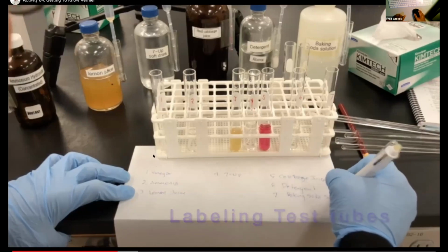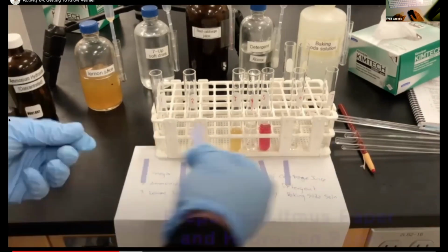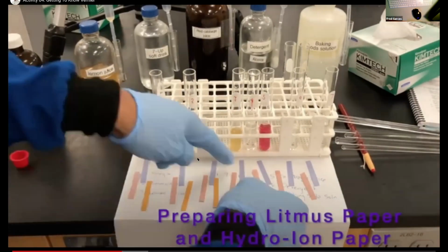Yeah, vinegar's to the left, so you don't see it right here. Vinegar is all the way to the left. That's why it's not shown in this picture. But this is how you would set up this experiment if you were doing it.